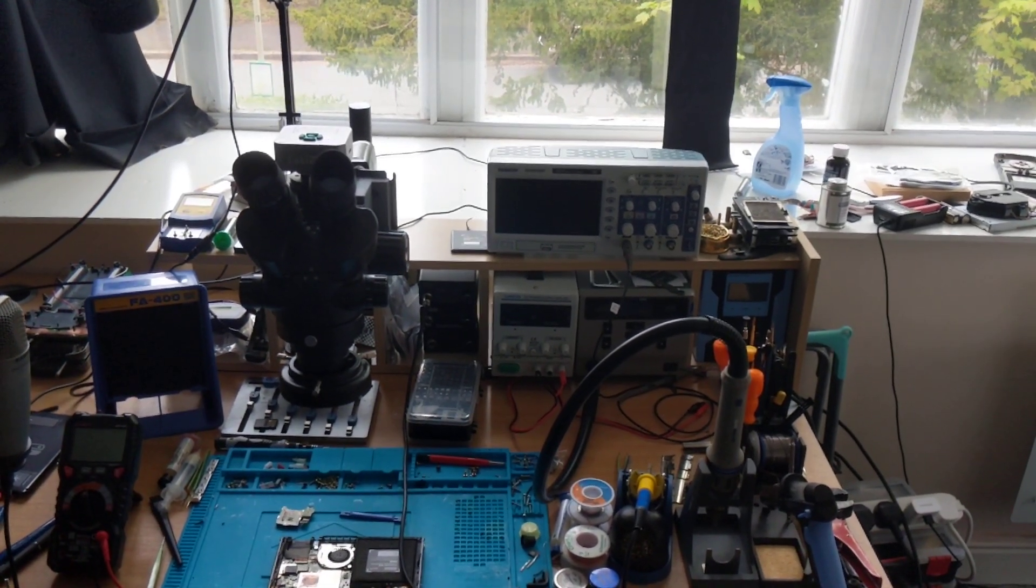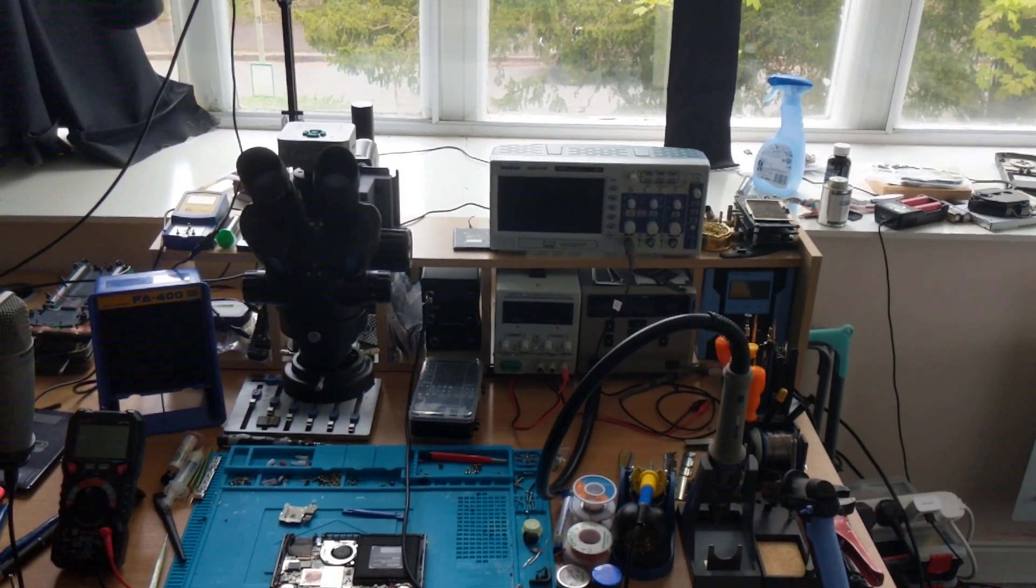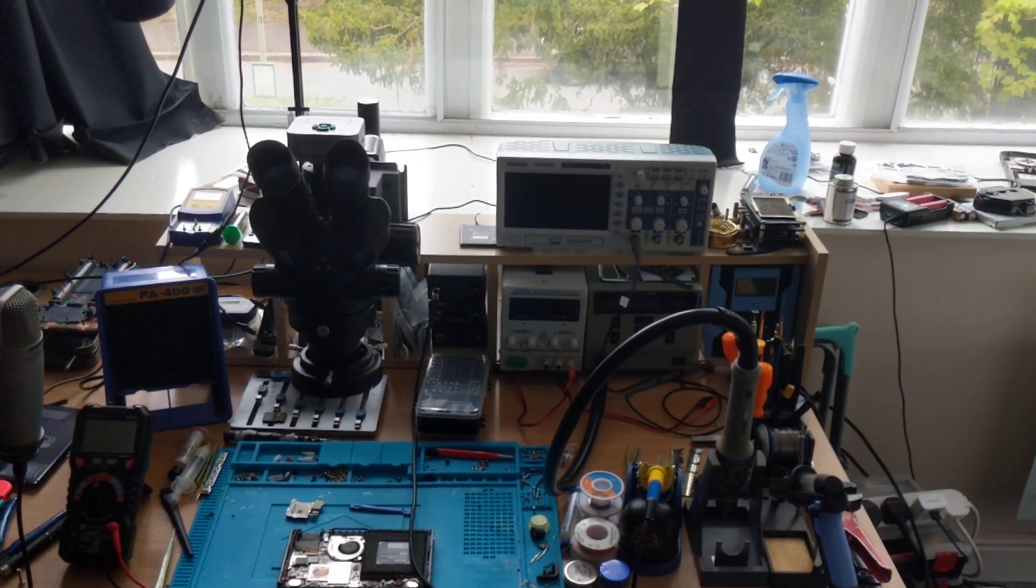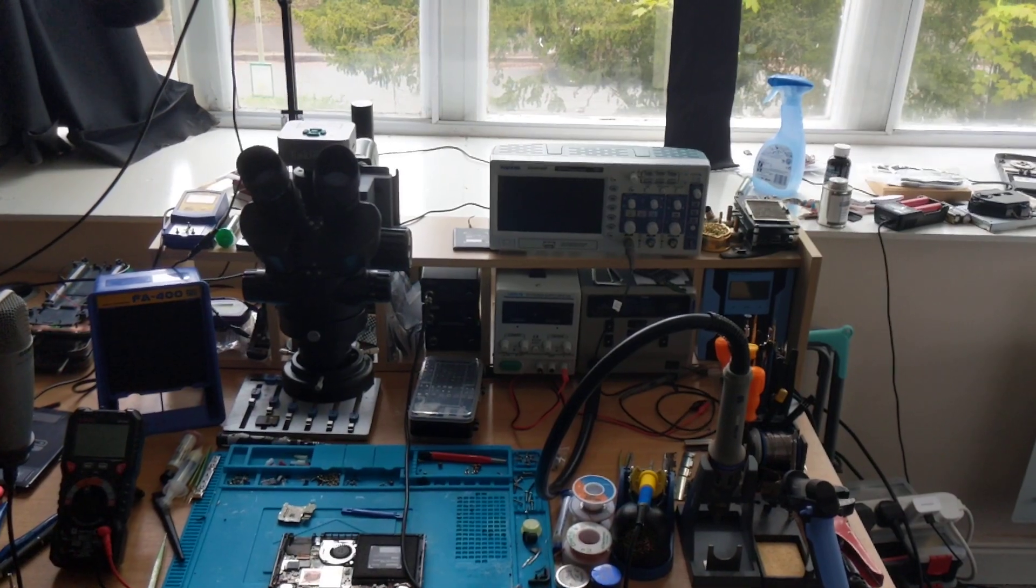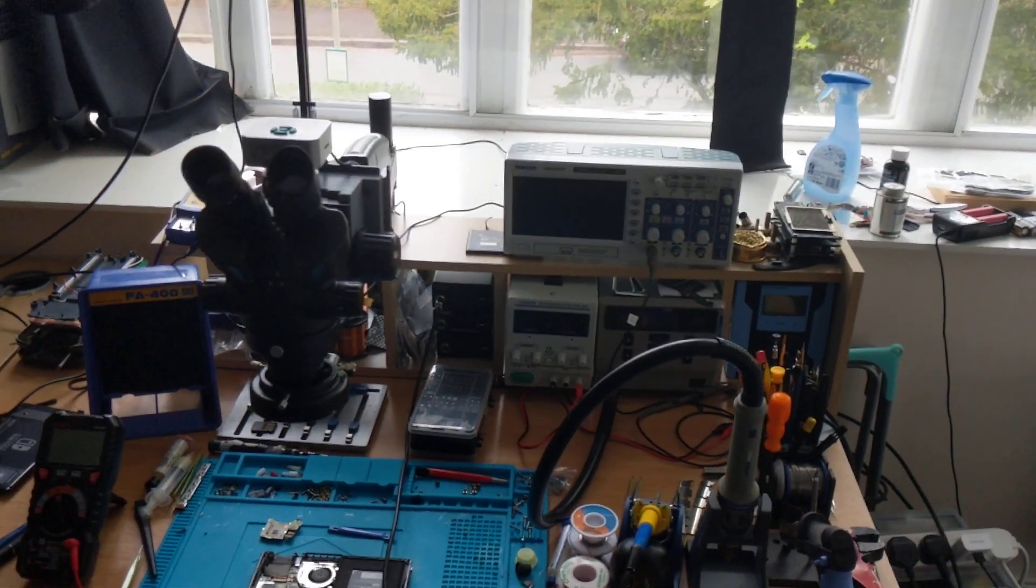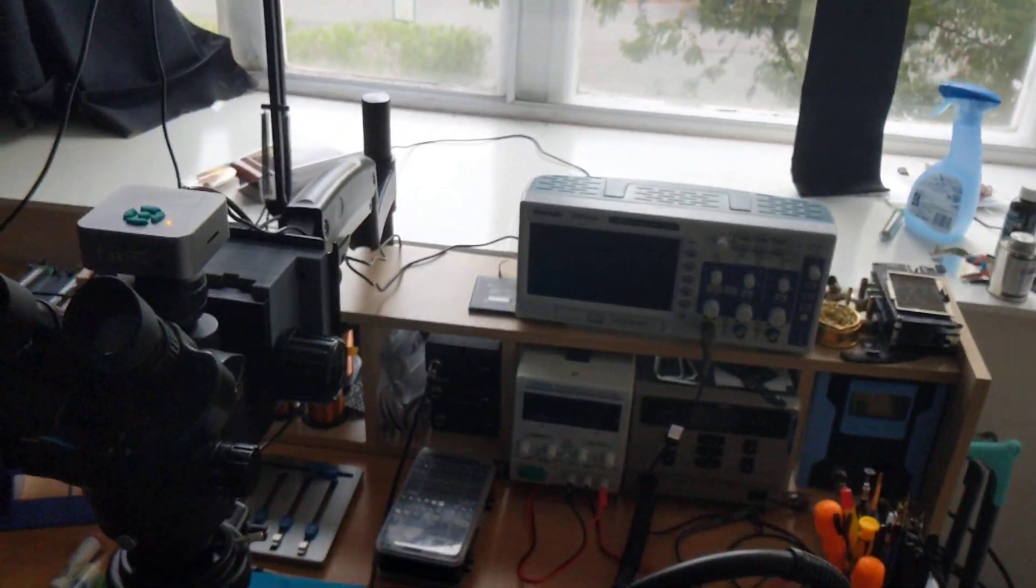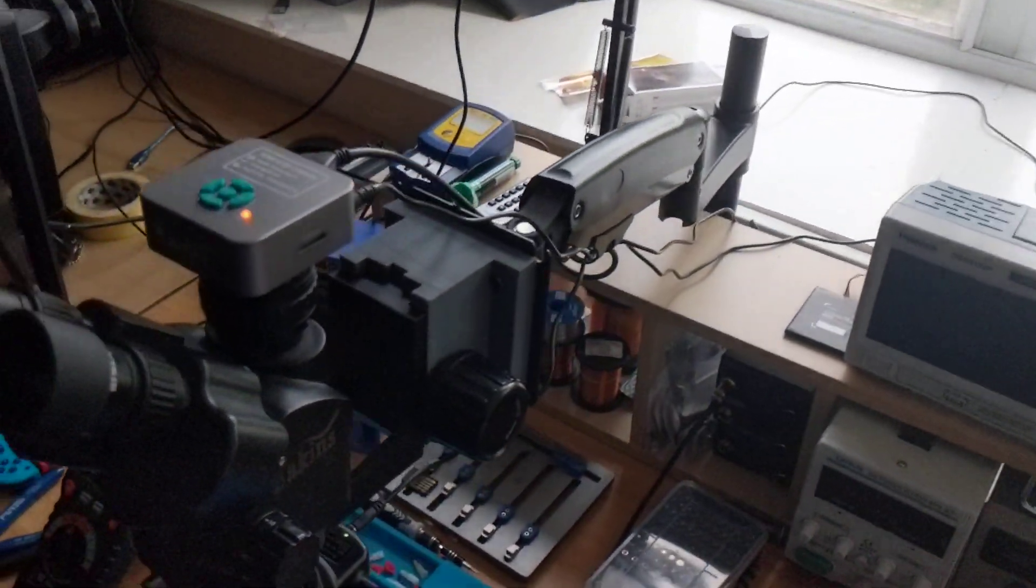Hello and welcome to the channel. I'm Cat Tech or Dan of New Retro Repair and in this video I'd like to detail a little project I've had on the go that you may find useful.